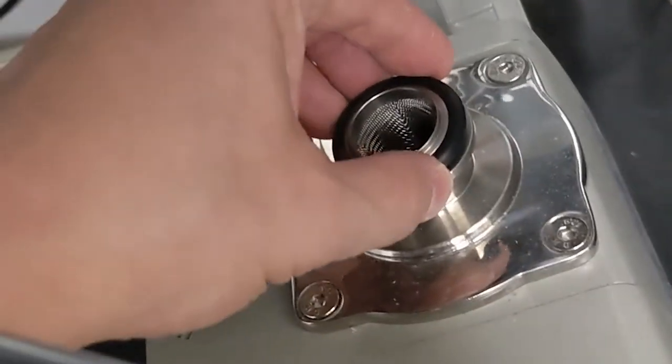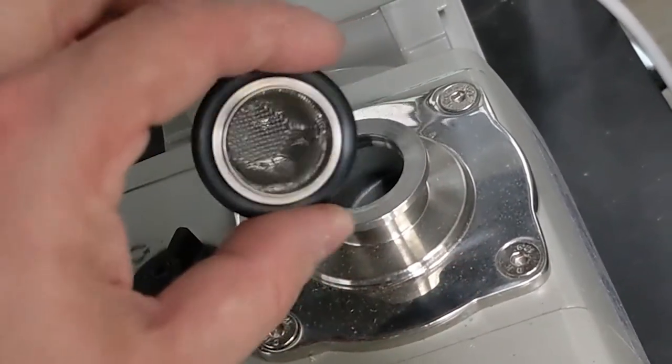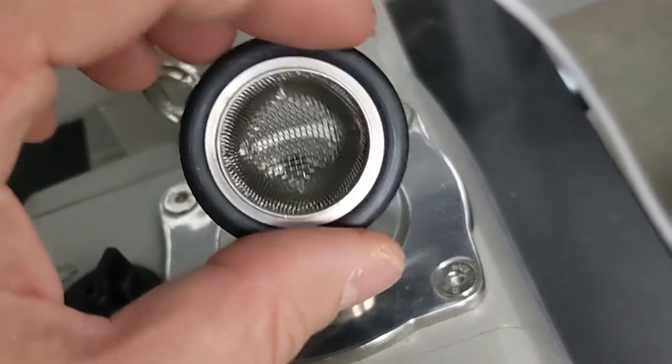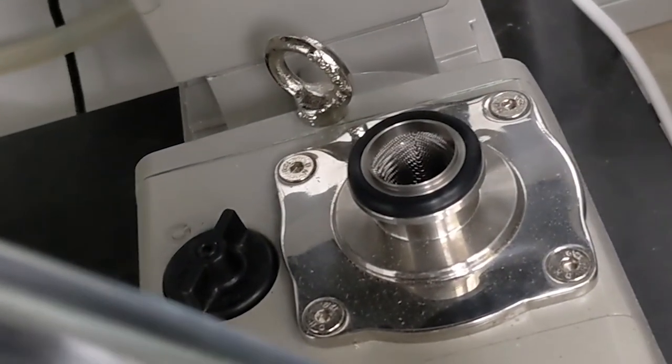At the pump you'll notice I've got this screen gasket that's shaped like a sock. This helps keep physical contaminants out of the vacuum pump. Most pump manufacturers will include that with it. It's important to use those to keep these oil-based pumps free of physical debris.